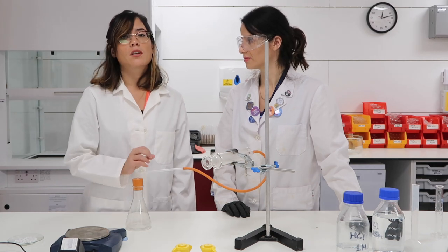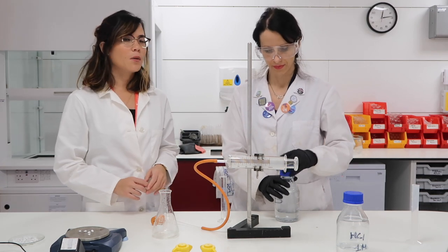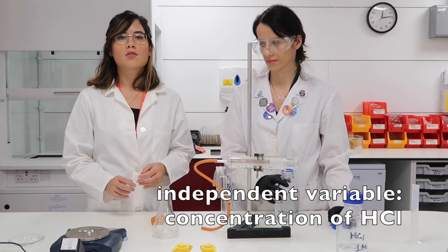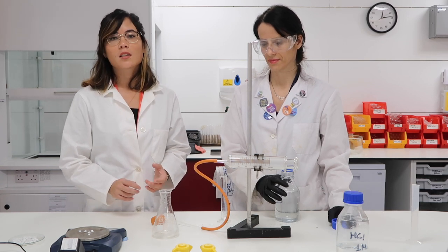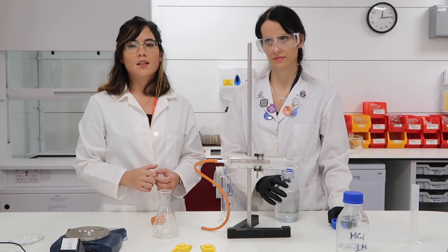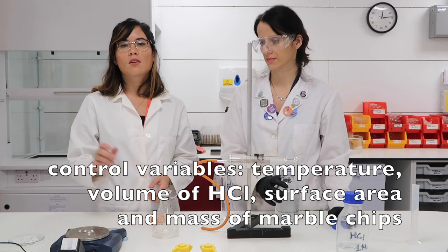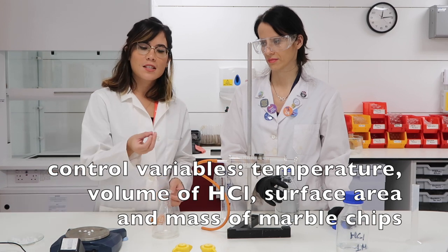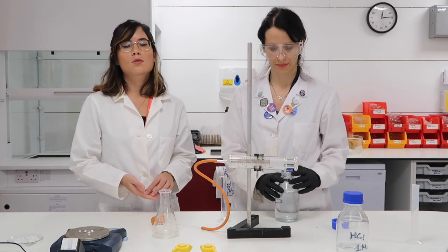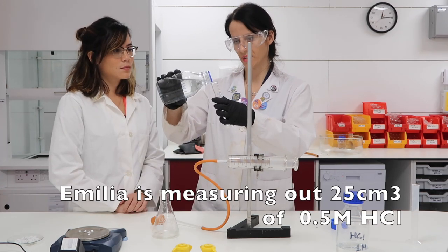We're now going to repeat the experiment this time using a lower concentration of acid. Notice that our independent variable in this experiment is the concentration of acid — that is what we are changing. Our dependent variable, what we're measuring, is the volume of carbon dioxide produced in 30 seconds. Our control variables — what we need to keep the same — will involve the mass of the marble chips, their surface area, the volume of acid added, and the temperature, which is quite difficult to control in a lab environment. 25 cubic centimetres.